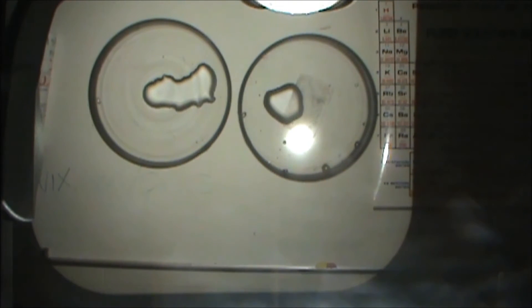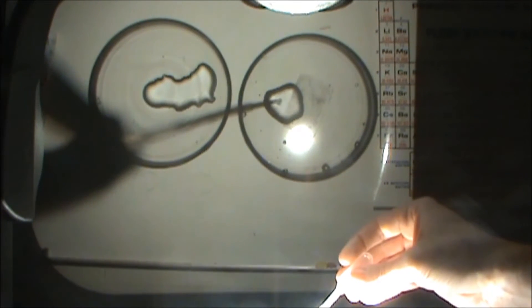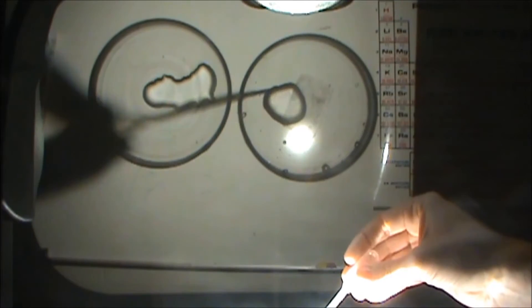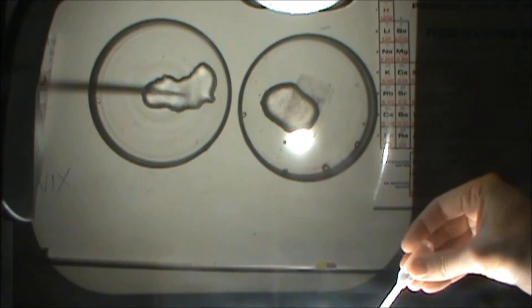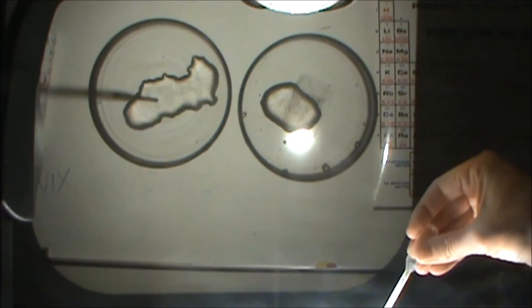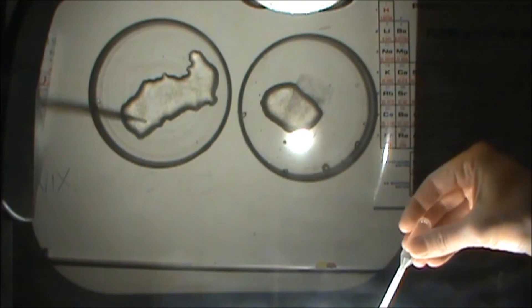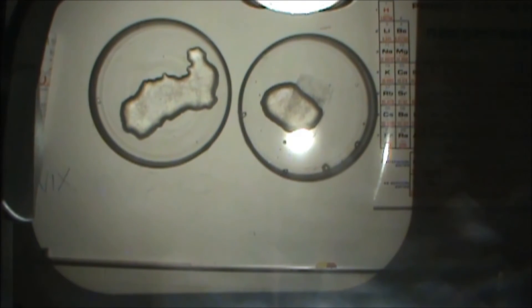And what we're then going to do is add a little bit of sodium hydroxide to it. Now the sodium hydroxide is more concentrated. When we do that, you should see the formation of a precipitate. And so you can see that cloudiness there present on the overhead that wasn't there before. We'll do the same thing over here. So we have zinc hydroxide present in both of these. And zinc hydroxide is something that's amphoteric, and that means that it can act as an acid or a base.